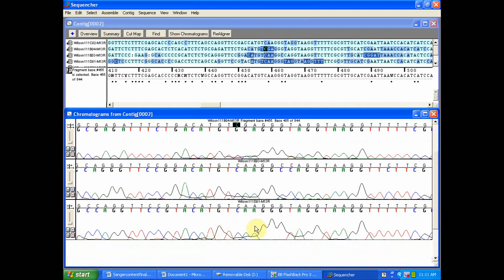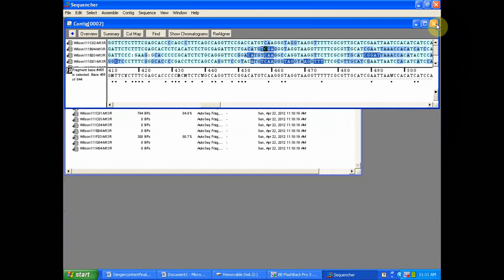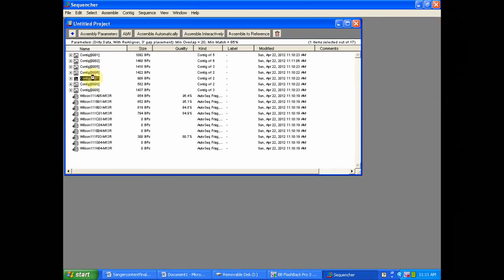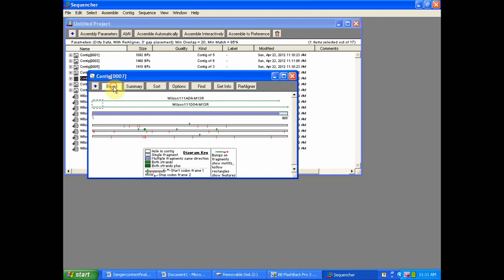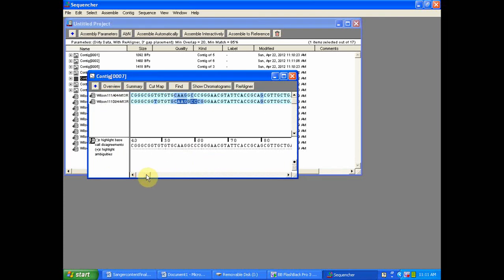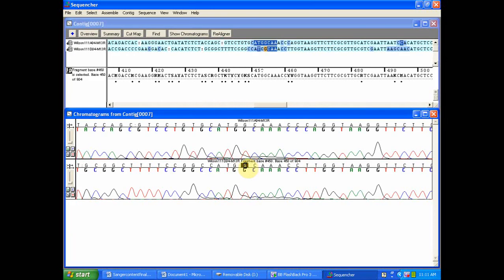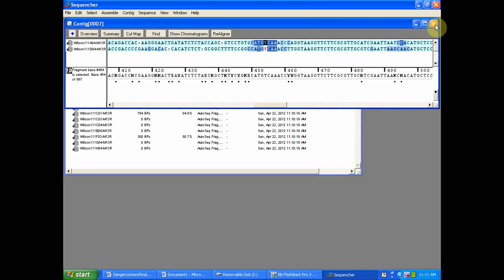Often sequence trims are performed without even previewing the sequence data, so Sequencher was designed to make the customized analysis needed for your particular project easy, and these tutorials were designed to give an introduction into how to utilize Sequencher to interface with the information contained within your sequence files. So during this brief introduction, as you can see, I was able to import, trim, align, review, and edit some of the sequence data I'm going to be discussing in further detail during these tutorials. I'd like to go ahead and begin now.